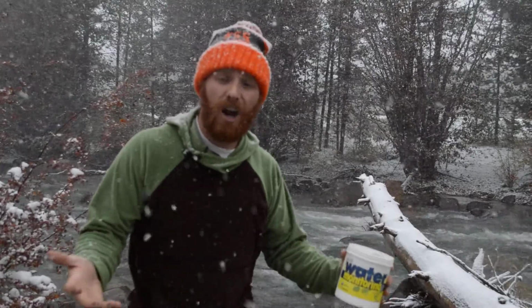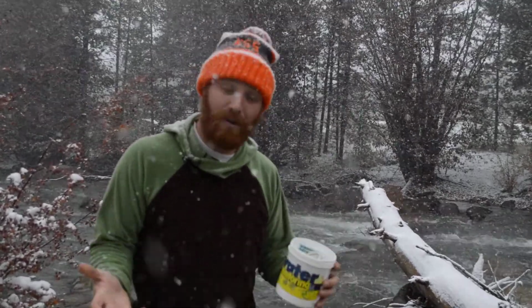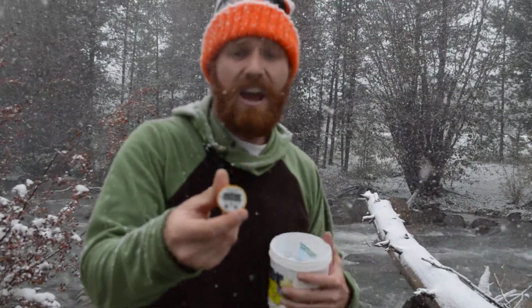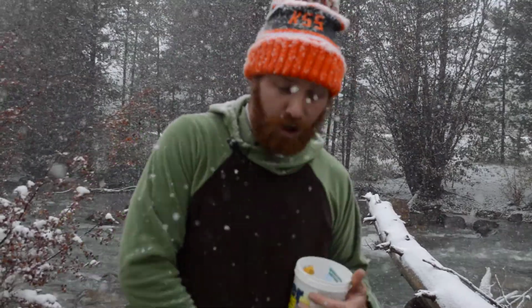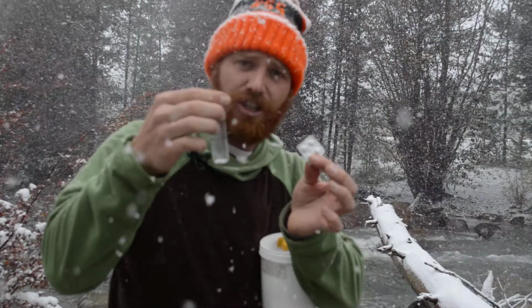It's important that the water is nice and clear so that the aquatic life can find their way while they're swimming around. Now, another thing that we're going to be testing is temperature, using thermometers just like this. If the water's too hot or too cold, it's going to be really hard for aquatic life to live in there.